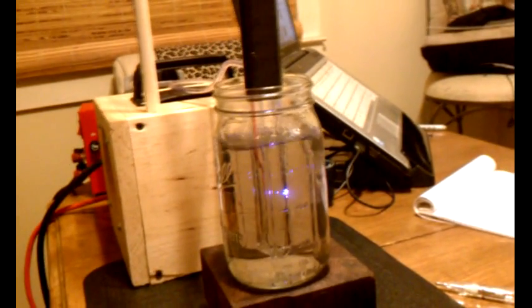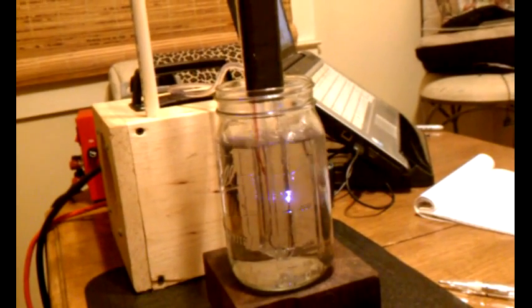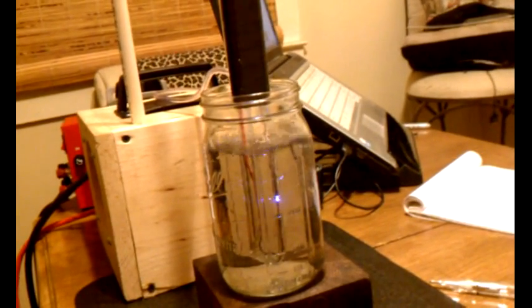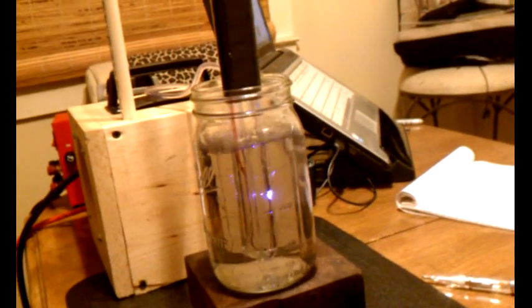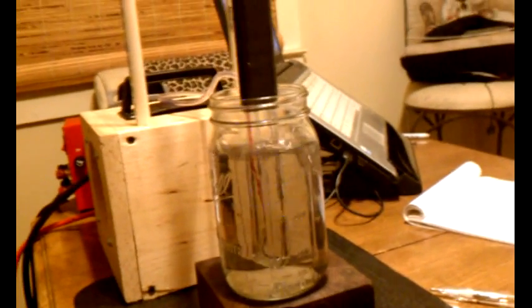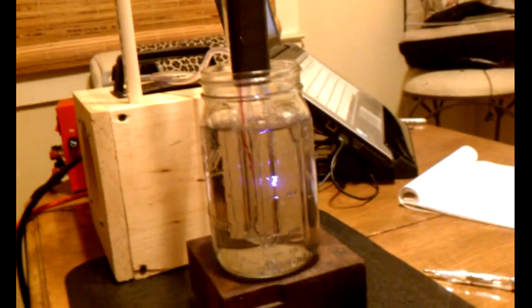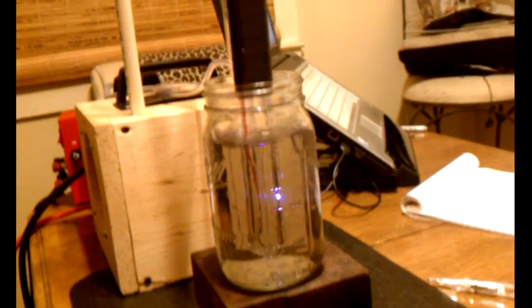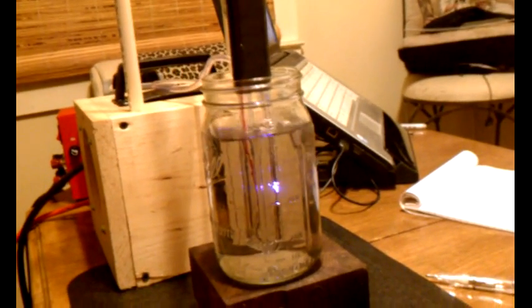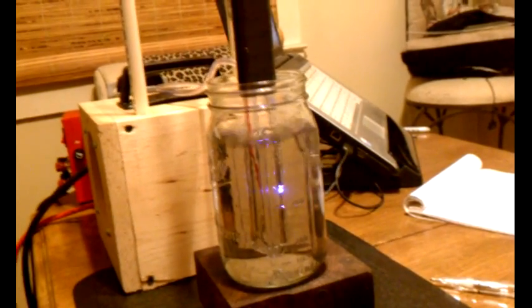I'm trying to keep the voltage as low as possible. My electrodes really ought to be a little bit closer together so that I can turn the voltage down even more. Because right now, as you can see, it's running at about 65 volts, which is really too much. So I'm going to make an adjustment here and see how it goes.